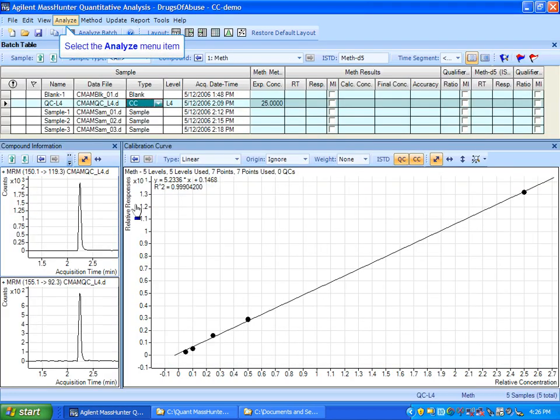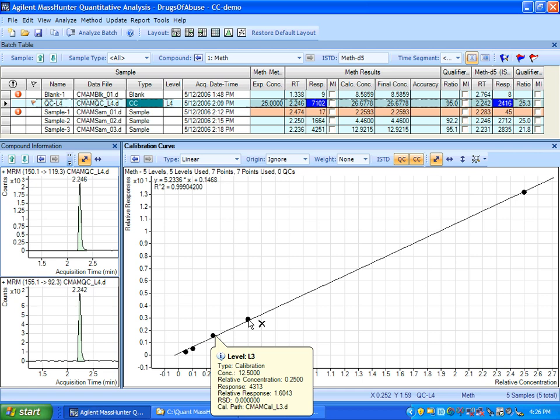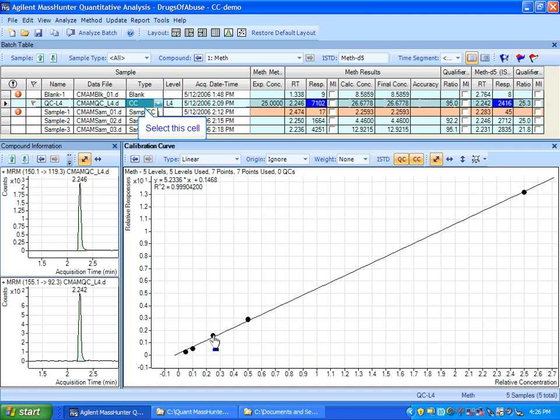Now I'm applying the method, and next I'm going to not analyze the batch, but I'm going to quantitate the batch. Notice that the quantitate batch does not change the calibration curve. This is my initial calibration curve here, and what I need to do is to evaluate this continuing cal sample against the initial calibration curve to see if I've passed the acceptance criteria. And we'll look at how to set that up with the method editor in a moment.